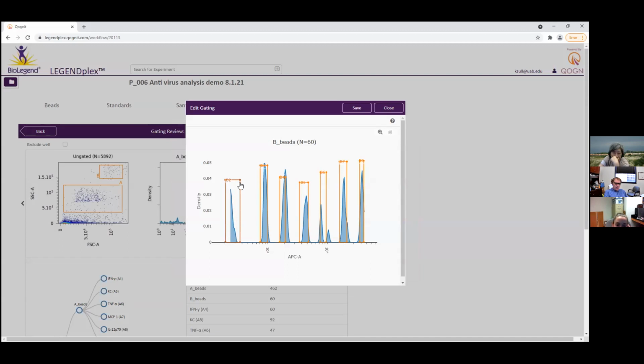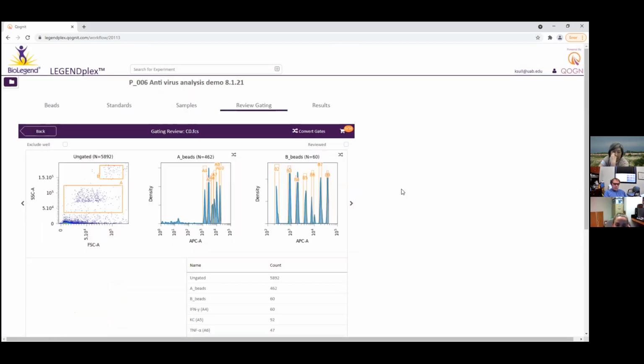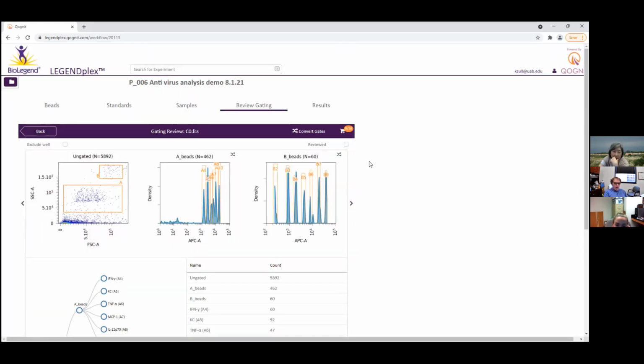Oh, there you go. Yeah, all right. So I can move it, save stuff like that. All right, okay, that's all. I was just wanting to know what's different now than then.